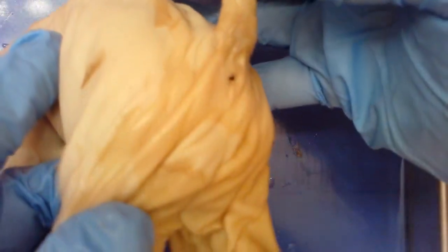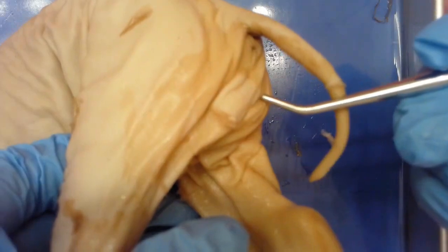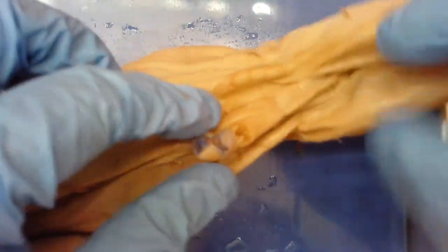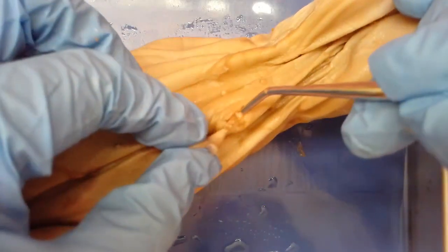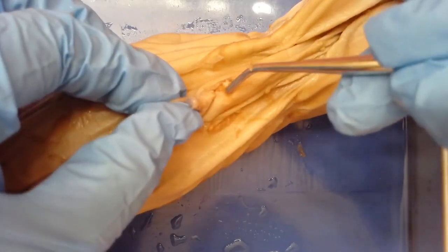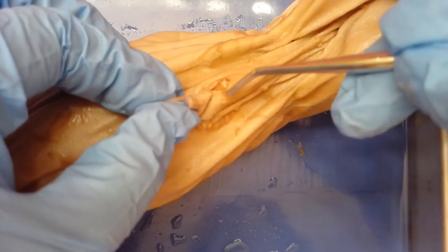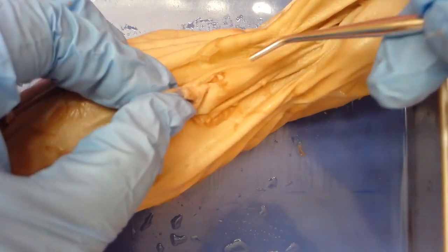Now looking at our male pig from the rear — you notice there is an absence of urogenital papillae. You still see the anal opening. You also see a little bulge in the rear part of the pig — that is actually where the testes are housed, so this is the scrotal area. That's one difference from the female. Since there is no urogenital opening here, the penis exits in a different location — just posterior to the umbilical cord is a little opening right here, with a small area where there is hair. This is where the penis in the male would exit during reproduction. When we look at the reproductive system in more detail, we'll show you where that structure is internally and where it exits during the reproductive process.